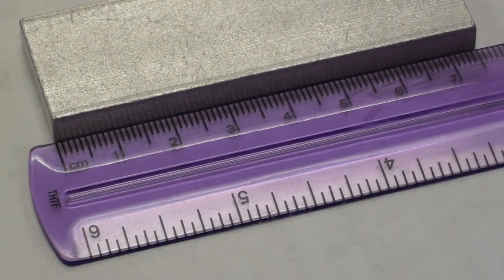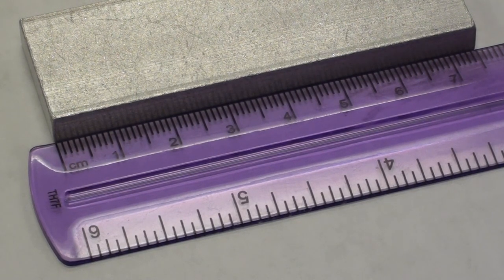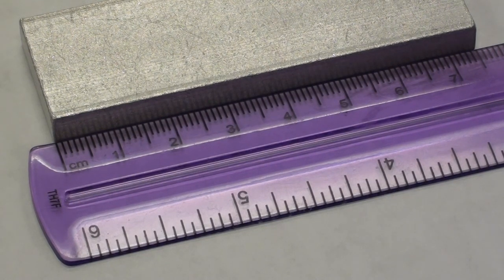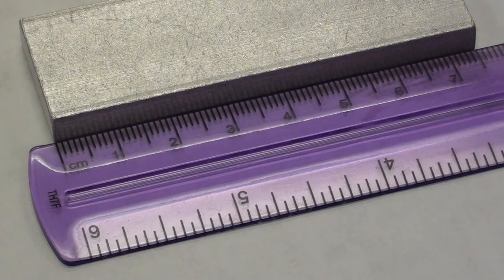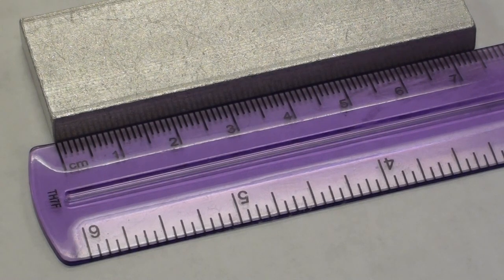This is the part where we're going to measure the volume of this aluminum block. Now it's possible to measure this volume because it is a regular shape, it's basically a rectangular prism. And we're just showing you here how to measure one dimension, that'll be the length. You can see that we're using a ruler here.